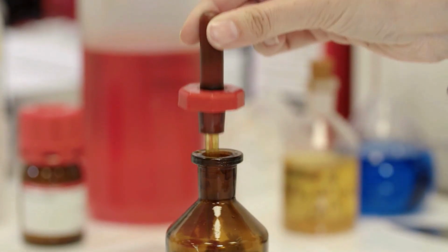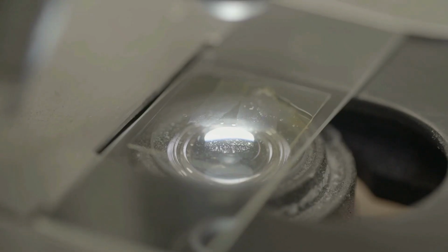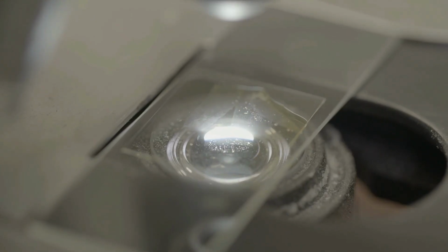Put a drop of iodine solution to stain the cells so that we can see the different structure of cells. And you can use a filter paper to absorb the excess iodine. You can also put the iodine in the epidermis first before covering it. Wait for 1 minute. Place the slide in the microscope. Select the objective with a powerful lens and focus.